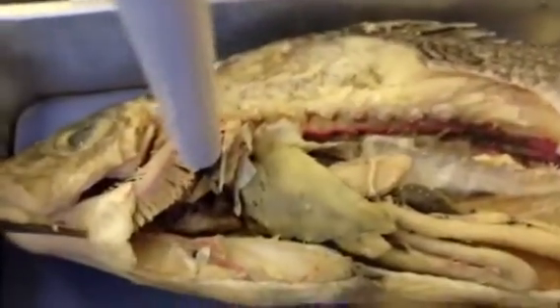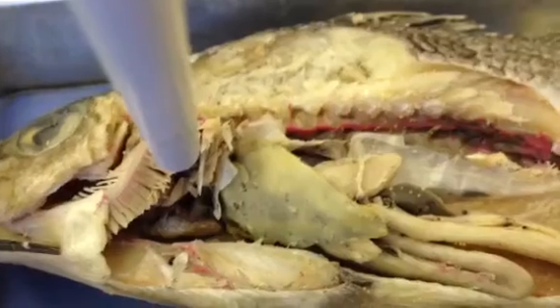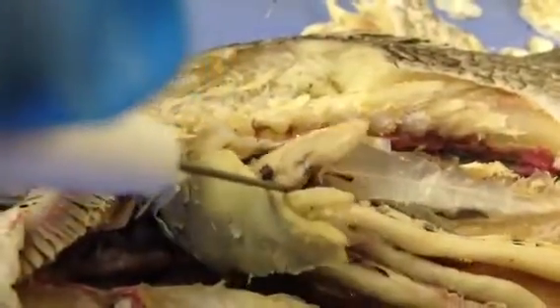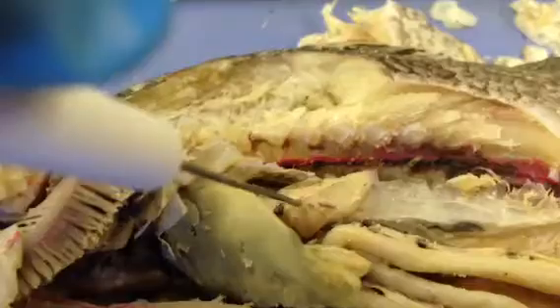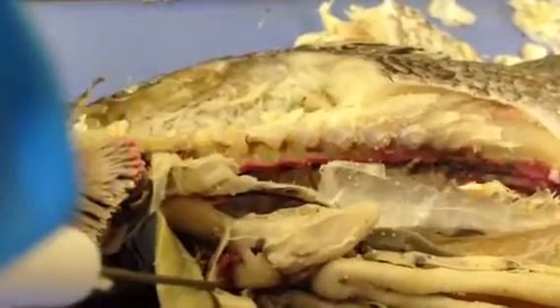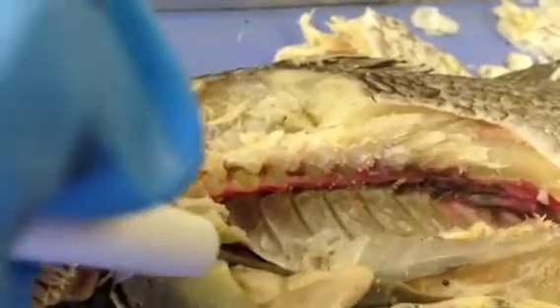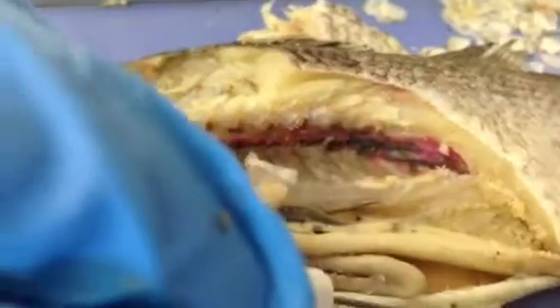And I think that is it. Don't forget that underneath the stomach, you're supposed to have the ventral gastric arteries. So right here, you're supposed to see a lot of arteries under the fundic part of the stomach, ventral gastric arteries. And yeah, I did. So I think we're done.